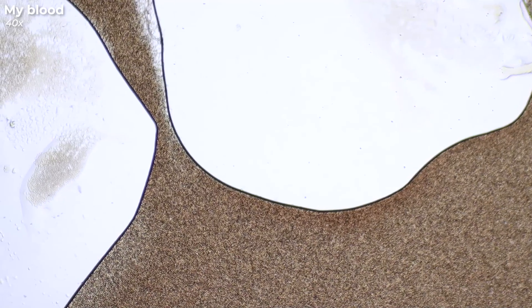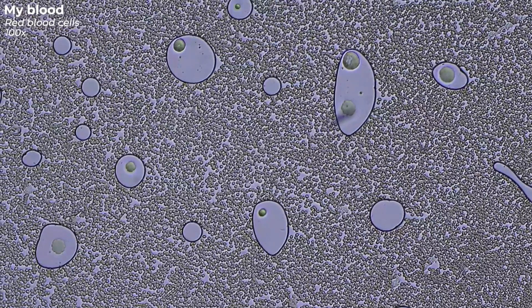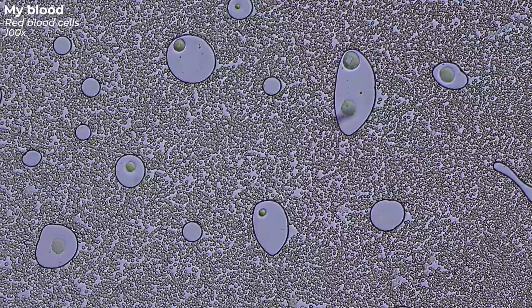At first glance, this flowing mass looks like an image of white noise. The two large white areas are air bubbles that have been trapped under the cover glass. If you pay attention to the edges of the air bubbles, you can spot the movement of many small particles. Under a higher magnification, you can now observe the countless particles even more closely. All these small, round discs are red blood cells, also called erythrocytes.